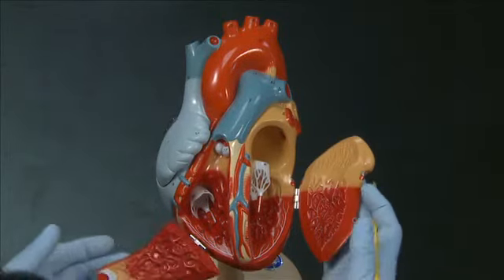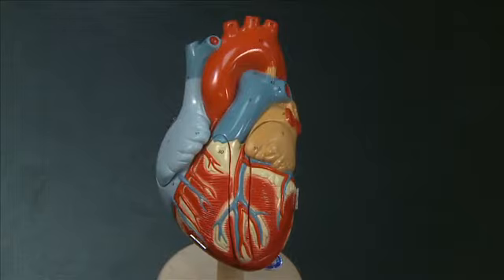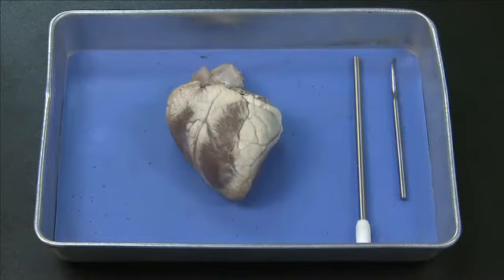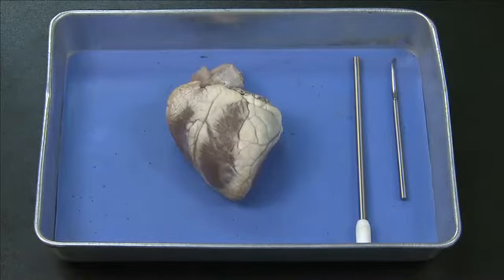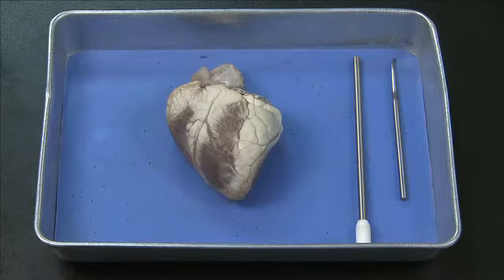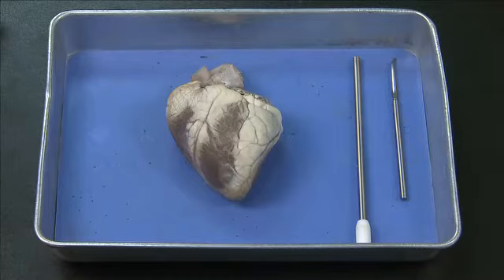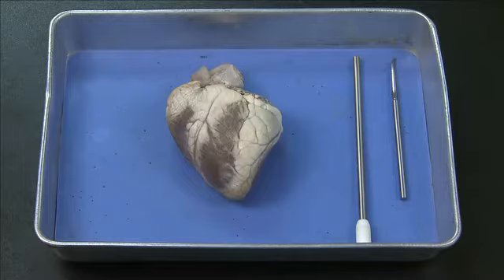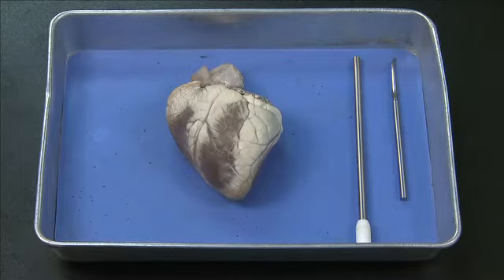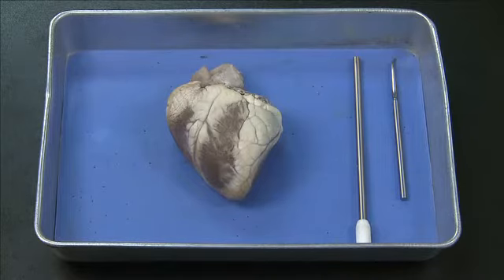That covers all the structures on the human heart model. Now we'll dissect a sheep heart and look for the same structures on the real organ. Remember that every heart is different, so the heart you look at in lab might not be exactly the same as this heart. But you should be sure to handle a real heart and get a feel for the look and orientation of the structures that you're going to be responsible to know. The first thing we're going to do is orient the anterior face of the heart by looking for the pulmonary trunk and the interventricular sulcus.